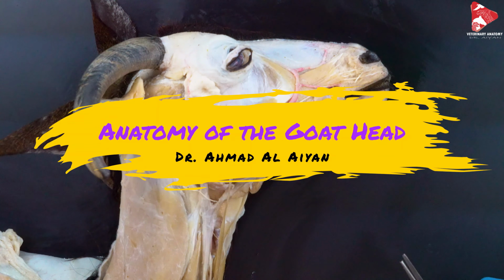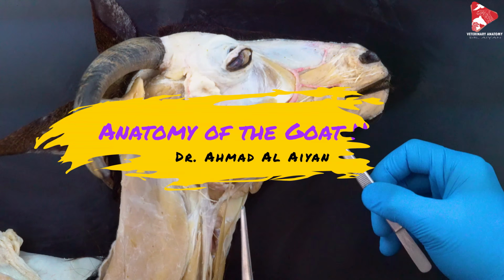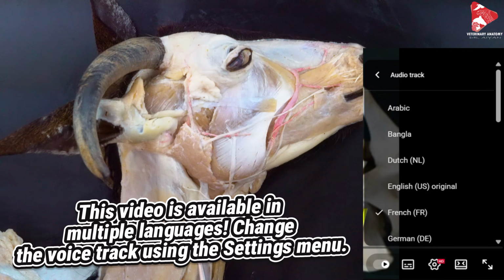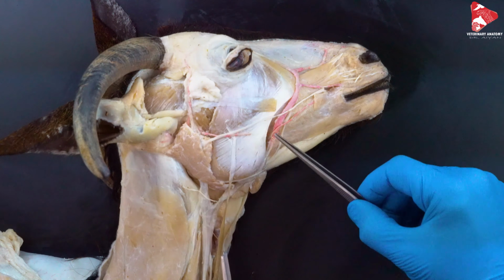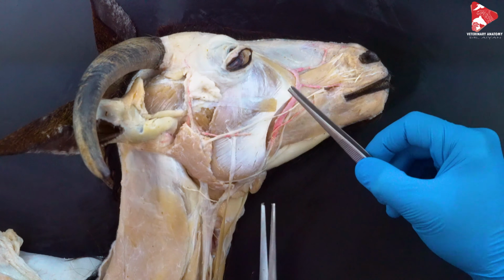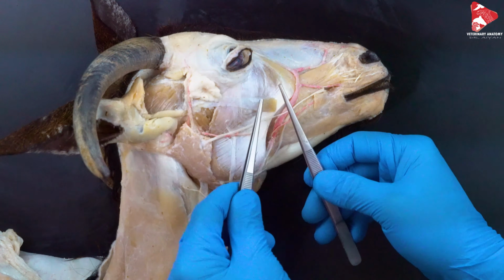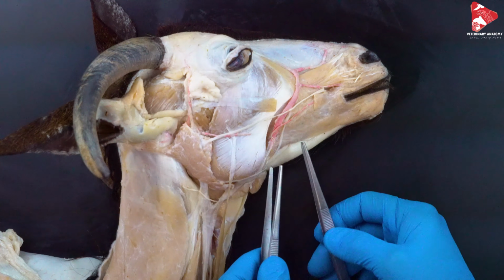Today we will start dissecting the goat, starting with the head. As you can see here, we already removed the skin and the facial cutaneous muscle completely, and even cut some of the muscles to make sure we can see the other structures below. So let's start mentioning the muscles we can see in this view.